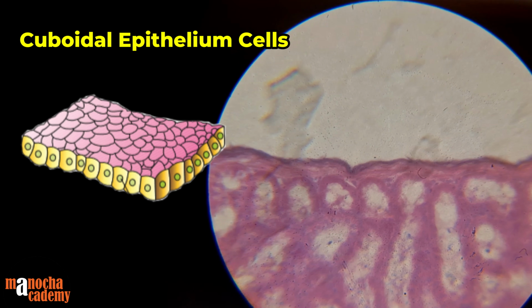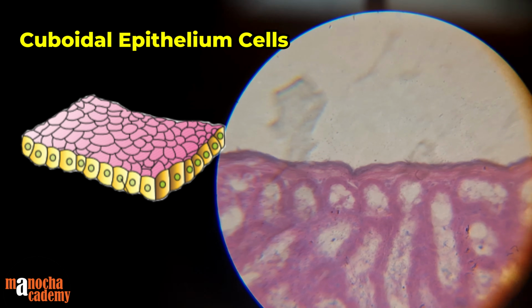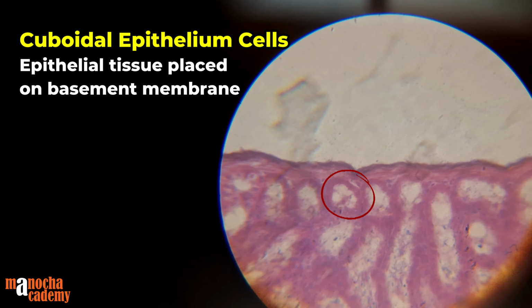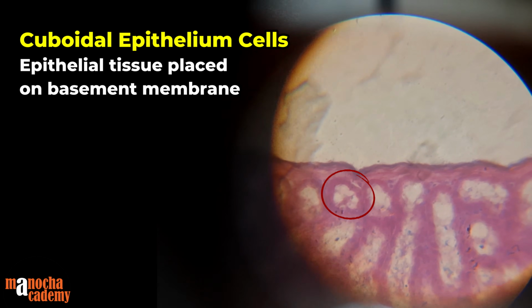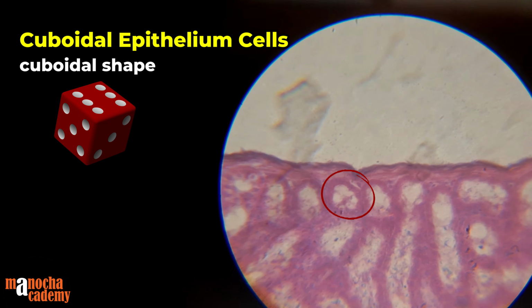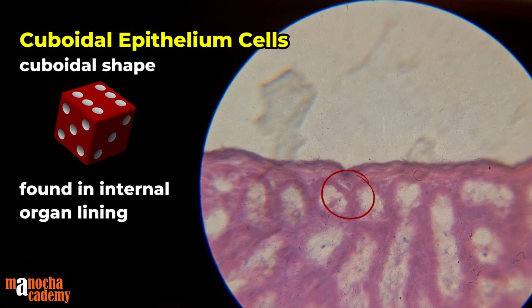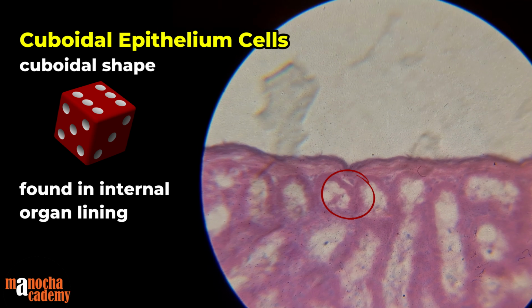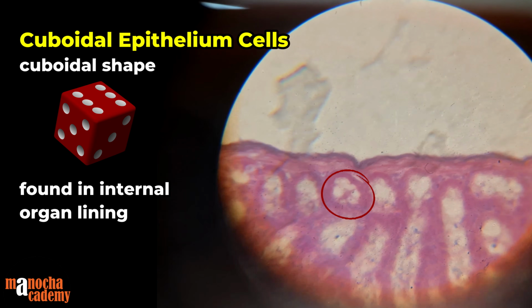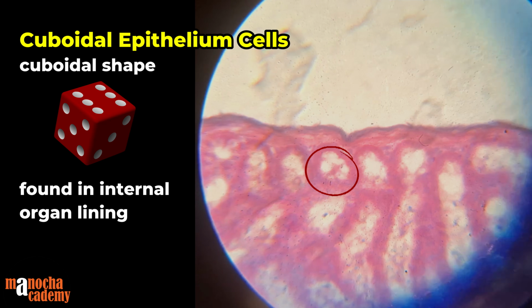The next one is a cuboidal epithelium. It's an epithelial tissue, so the cells are placed on a basement membrane. So the basement membrane is there, and the cells that are placed, as you can see, they are cuboidal in shape. Such kind of cuboidal epithelium lines the inner lining of some of the structures inside our organs. So for example, this one is a cuboidal epithelium that we see in the inner lining of a nephron. So this is cuboidal epithelium.